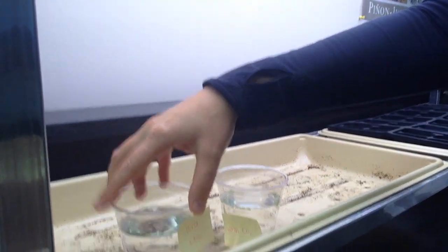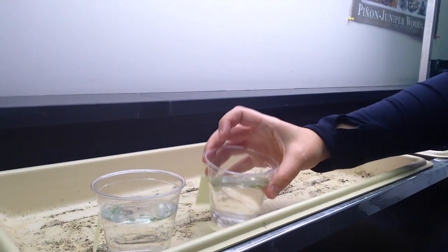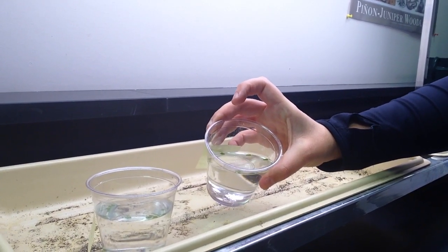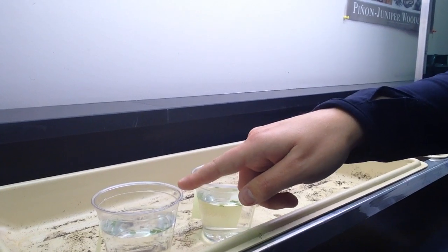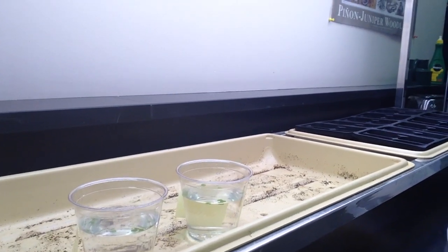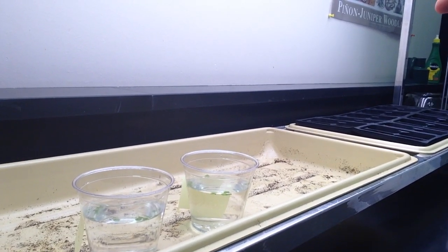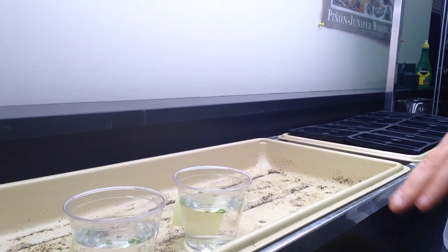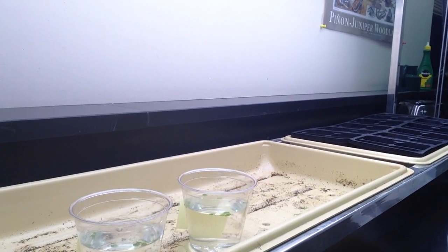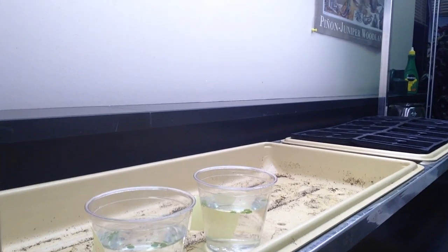Here's the one I just put in — with CO2, my discs are sunk. I did one more before I started videoing and you can see the discs have all risen. I sit and measure from the moment the 10 discs are in the cup to the moment 5 of my 10 are floating — that is the time measurement for that cup. In this lab you'll be measuring the rate of photosynthesis based on two different distances from a light source, comparing two lamps. If a cup has no floating discs after 20 minutes, we call that no reaction.